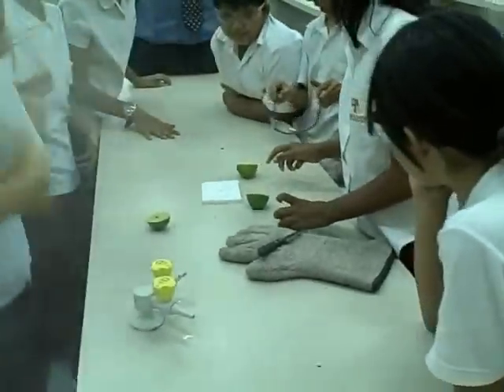Hydrogen must be what made the Hindenburg explode, isn't it? Yes, it's right. Very good. Are you allowed to breathe it or not? No, don't breathe it.